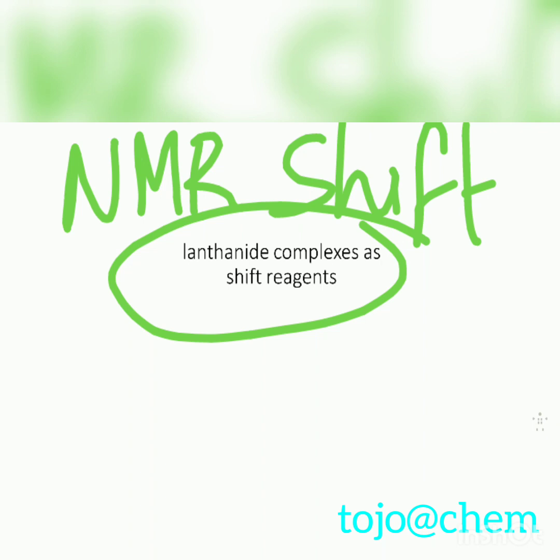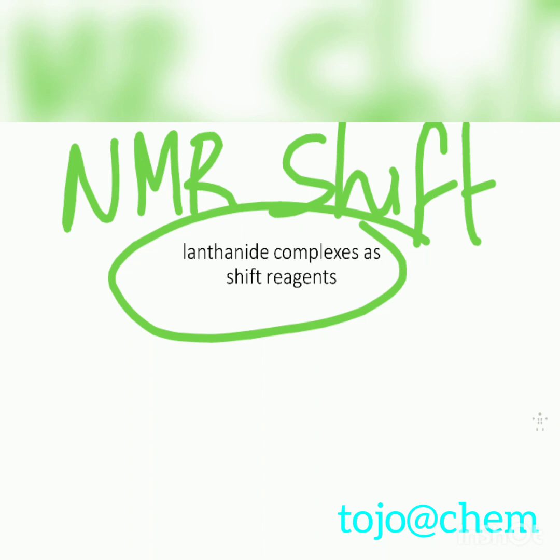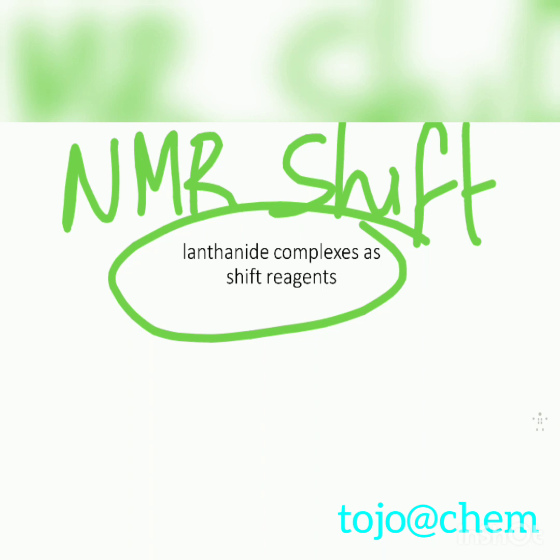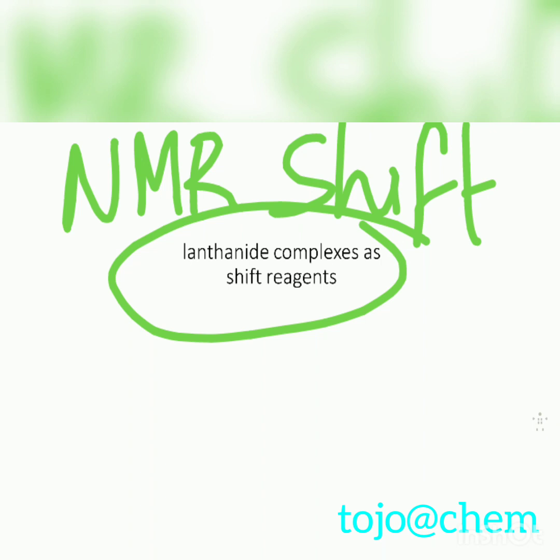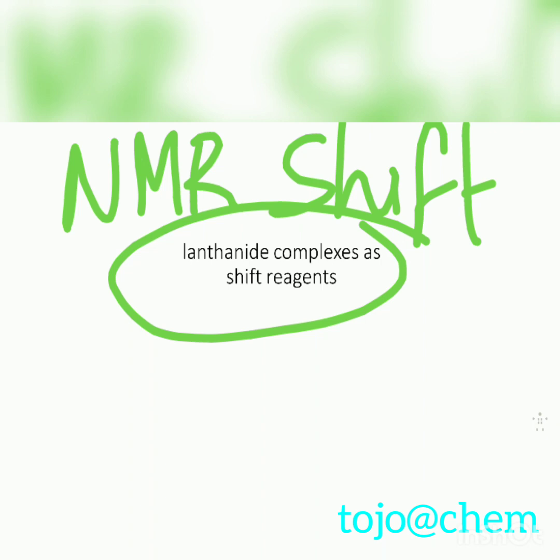In the first part, we have a normal NMR spectra.